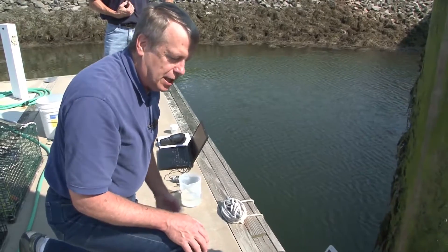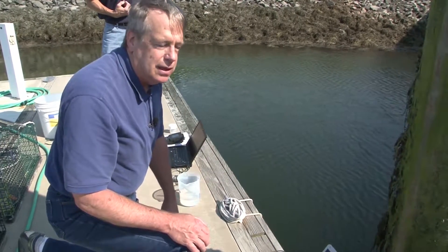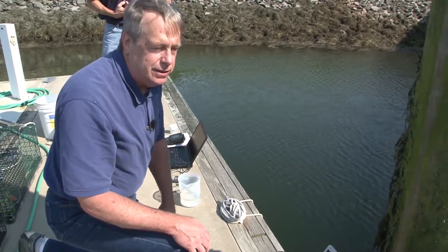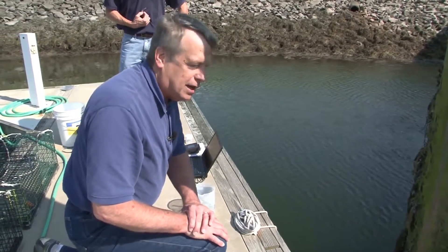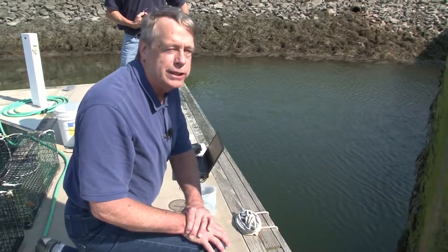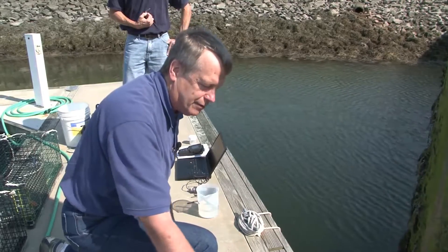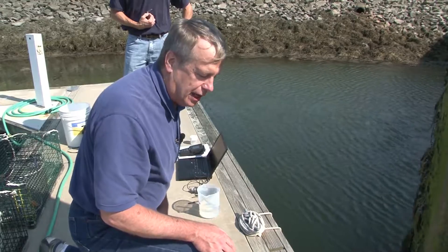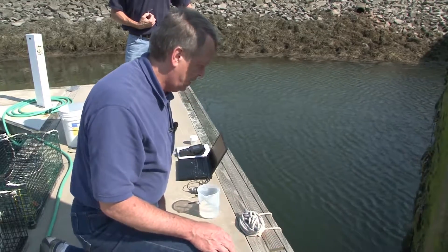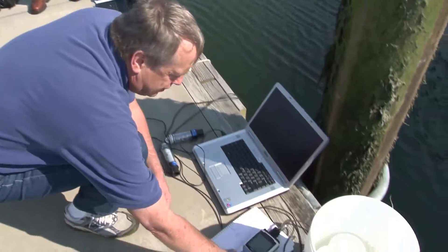Once I have this measurement done, we will pull these loggers out. We will clean the loggers, download the data from the loggers, and then redeploy them with a new launch cycle, and then take another set of readings for the beginning of the next cycle from the meters. So we'll have another set of DO, conductivity, and temperature readings at the beginning of the next cycle. First I need to record the data as we have it here.